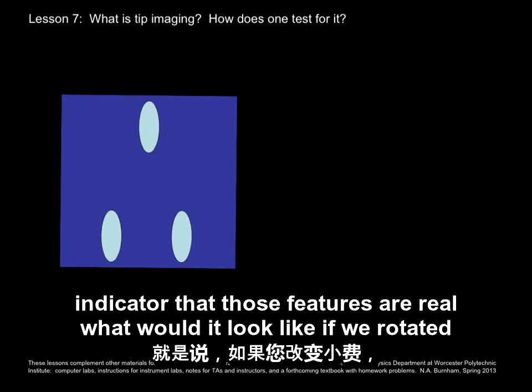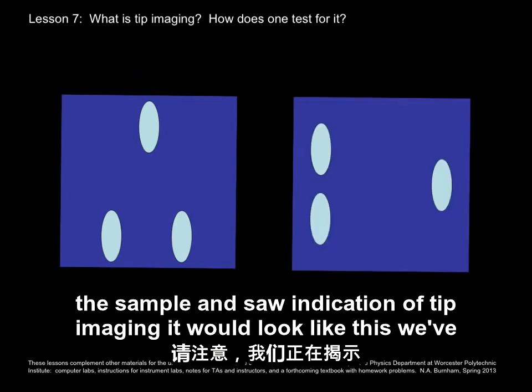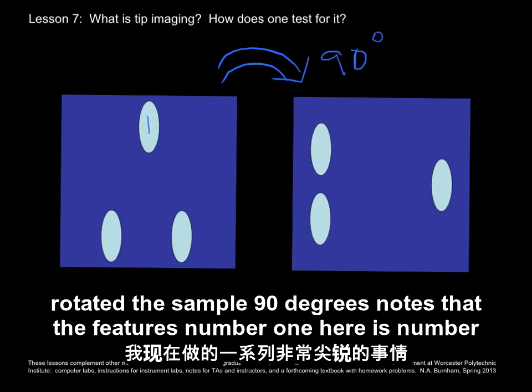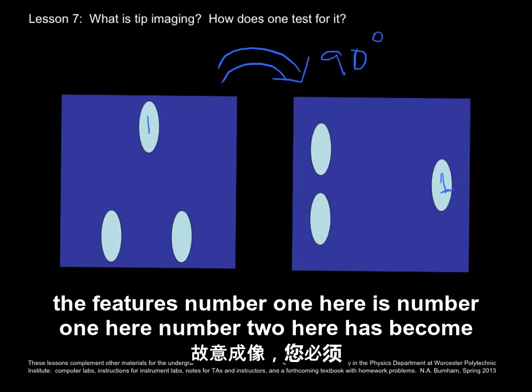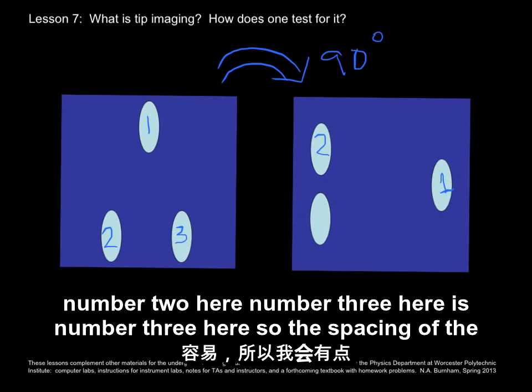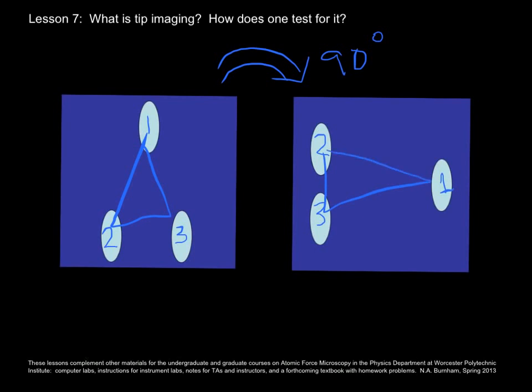What would it look like if we rotated the sample and saw indication of tip imaging? It would look like this. We've rotated the sample 90 degrees. Note that the features, number 1 here is number 1 here. Number 2 here has become number 2 here. Number 3 here is number 3 here. So the spacing of the features has remained the same. In all cases we have this triangle, but the orientation of the features has remained vertical. This indicates tip imaging.